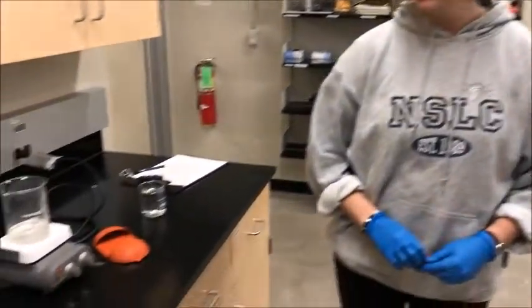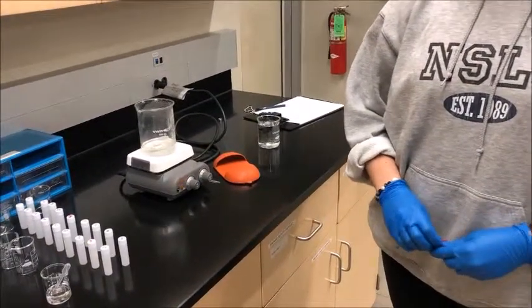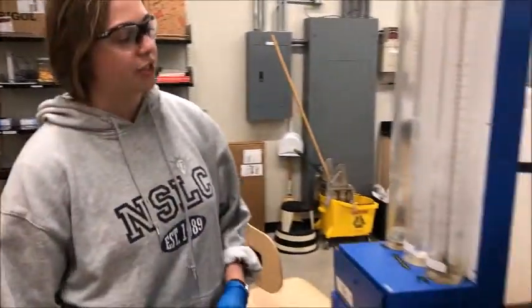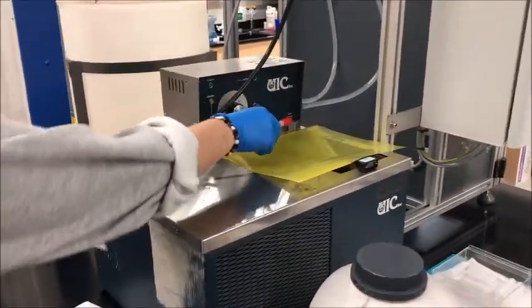Heat some water for use later in the lab. To do this, add a beaker to a hot plate with a magnetic stirrer as well as some water. Turn on the hot plate as well as the magnetic stirrer. We do this when we're adding water to solutions. We use hot water in order to not fracture the glass of our apparatus. Afterwards, turn on the cooling bath to 20 degrees Celsius and make sure that the flow control is open.